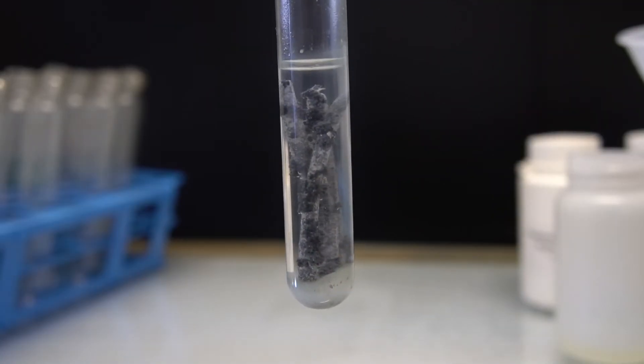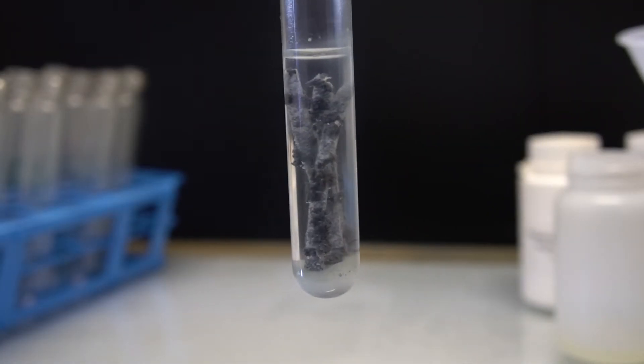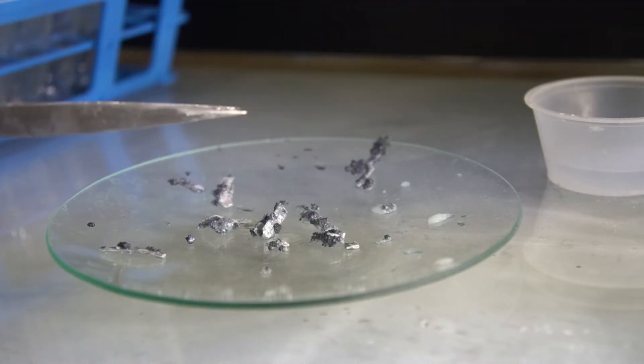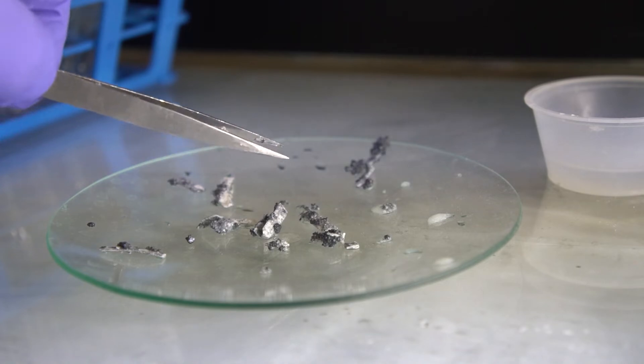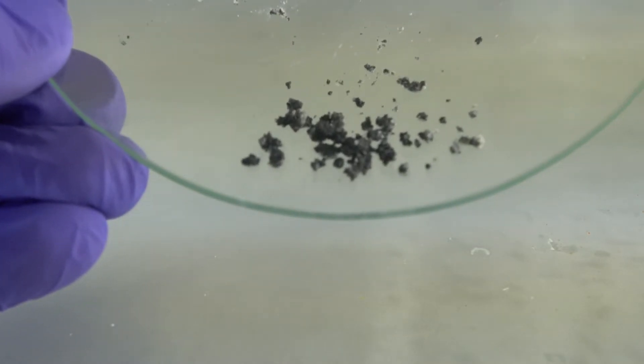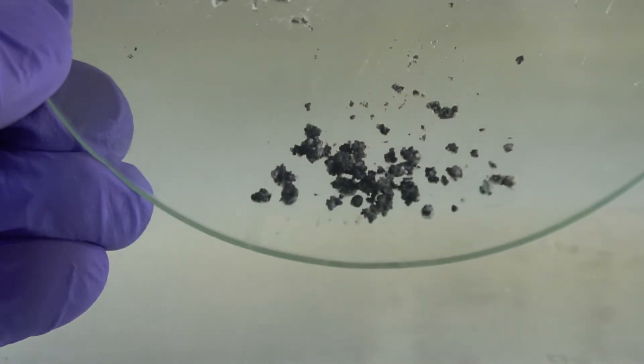So let's start solving our chemical mystery. The first step was to isolate the substance from the other insoluble compounds that were produced. This was done manually using tweezers. It took a while, but it was mostly effective, as the substance had a distinctive look and was easy to pick out of the mass that we pulled out of the test tube.